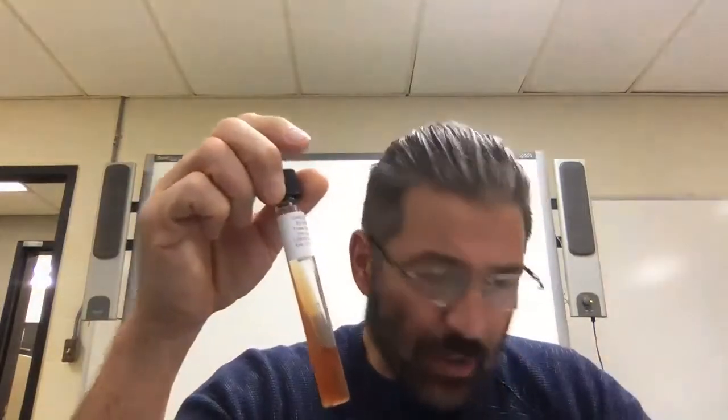So it's going to have glucose, lactose, another sugar, and protein. The bacteria are going to consume the glucose first, and then the lactose, and then protein last as their source. As bacteria consume glucose, they're going to ferment it and produce acids, so there's going to be a pH indicator. The pH indicator is going to change.